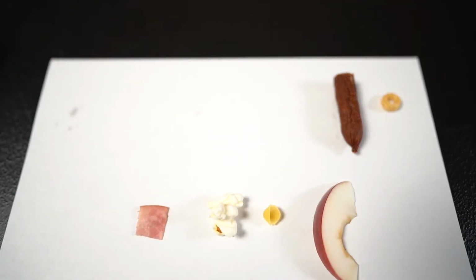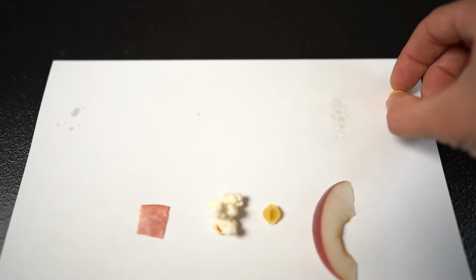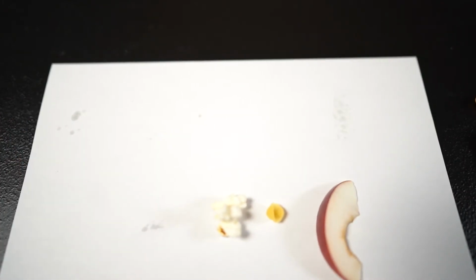So the results. When I look at the results, the pattern that I want the students to see is that, in general, the greasiest things, the stuff that really shows a grease mark, comes from animal products. Because animals deal with storing their energy in the form of fats, typically. You're not seeing fats show up in plant products like you do in animal products. So I want the students to kind of get that idea. Stored energy is more fats with animals.